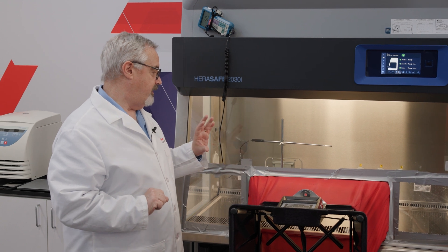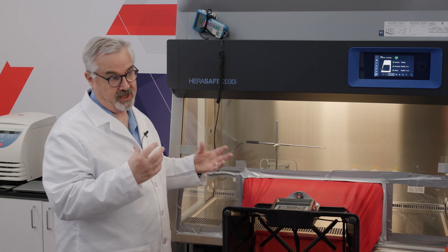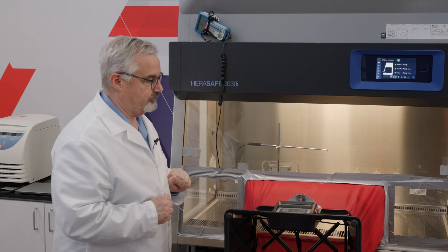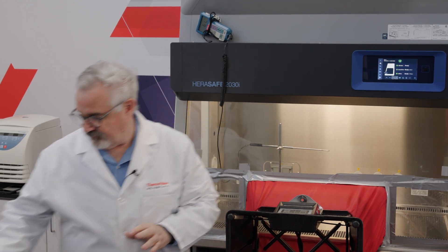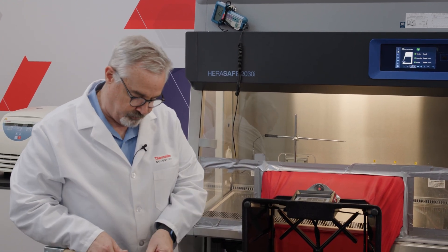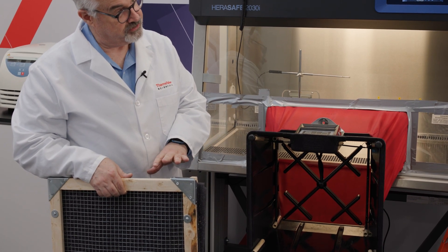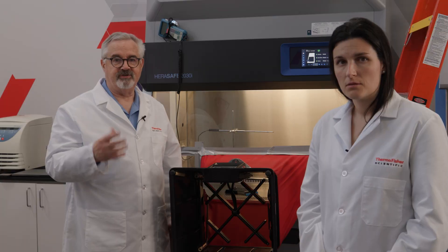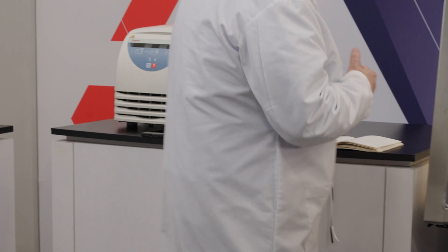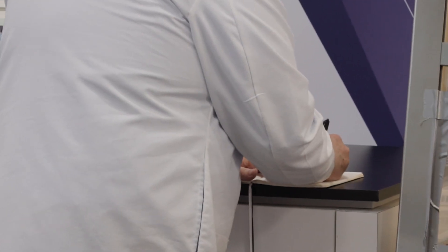Second, I have placed in the cabinet a thermal anemometer — again, the same type of device used to measure downflow as part of the annual certification — reading out in feet per minute, currently at 61 feet per minute. Third, I have crafted a frame with pre-filter material that will allow us to add a restriction just to the exhaust filter by placing it on top. Let's write down the current unobstructed readings: inflow CFM of 350 and downflow velocity of 61.